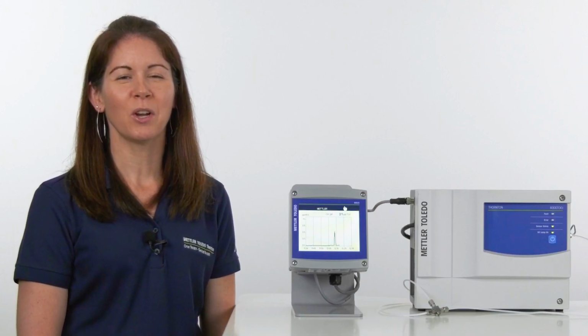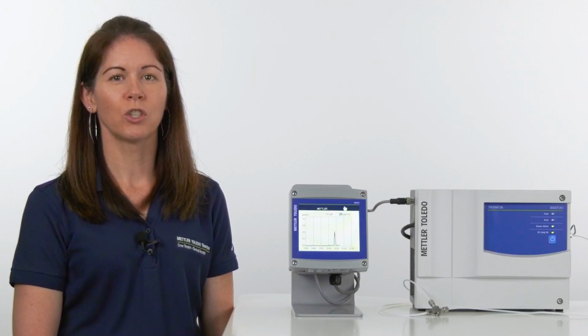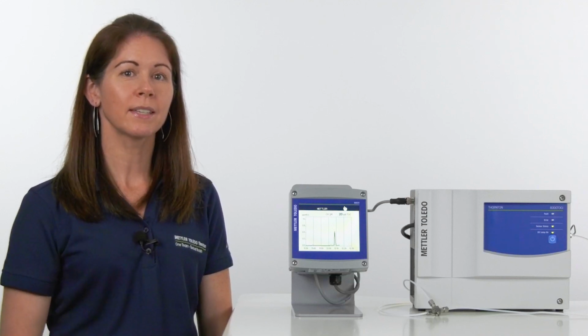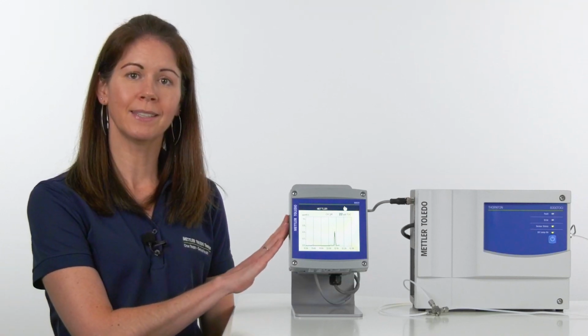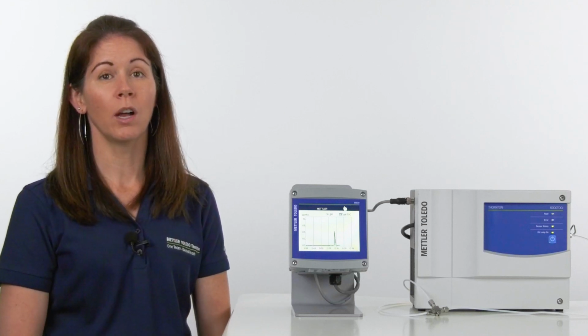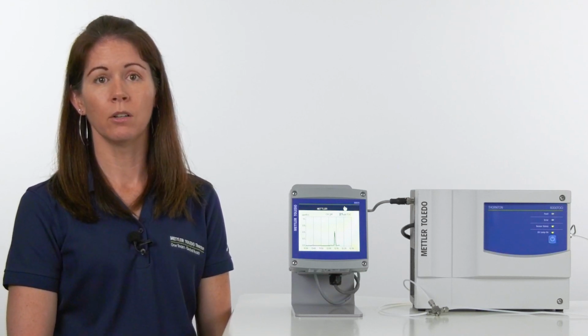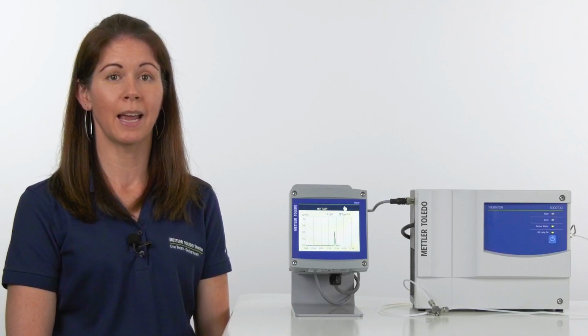As you can see, we caught the excursion in real time, which a continuous online TOC measurement will give you. In this case, the excursion lasted roughly 60 seconds, but we caught all of it, which a batch system won't do, as they deliver results roughly every 6 to 10 minutes at best. A lot can happen in 6 minutes, so a continuous online TOC measurement is the way to go.